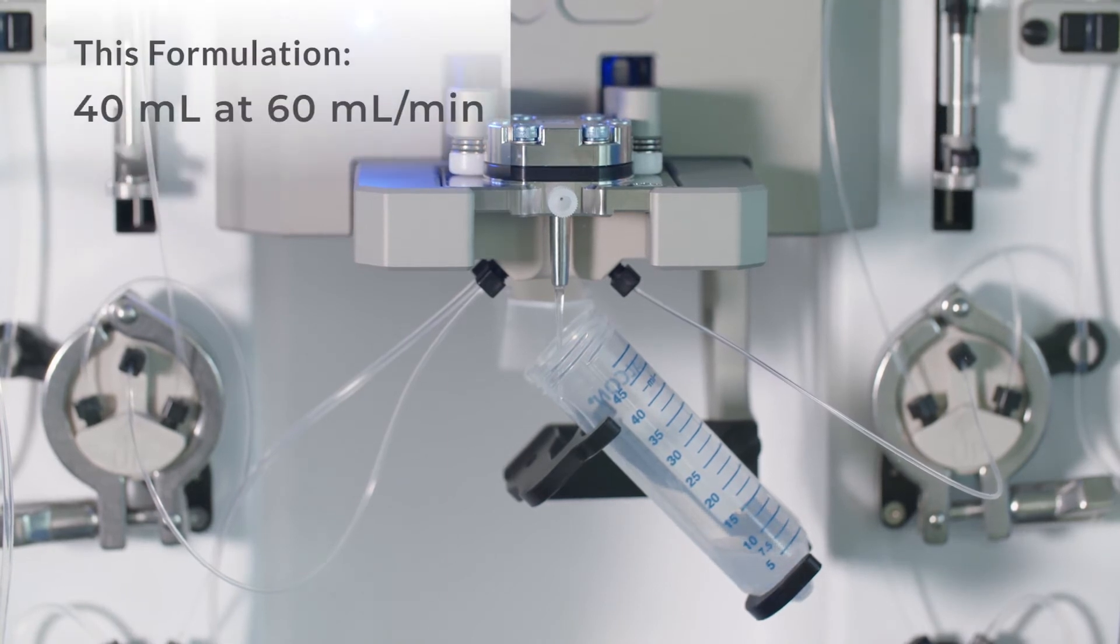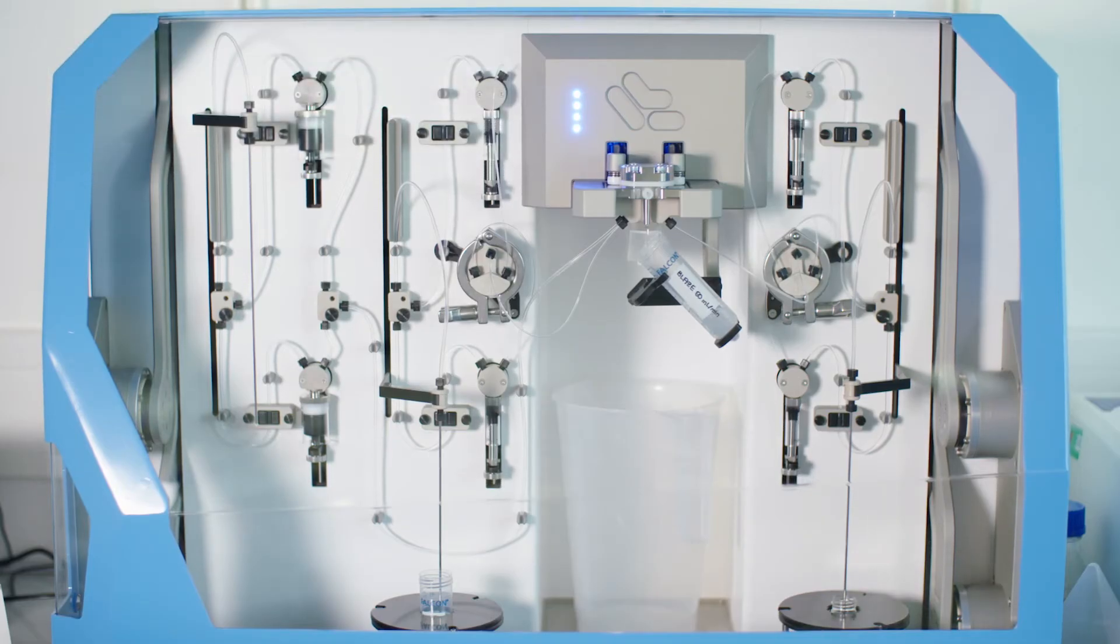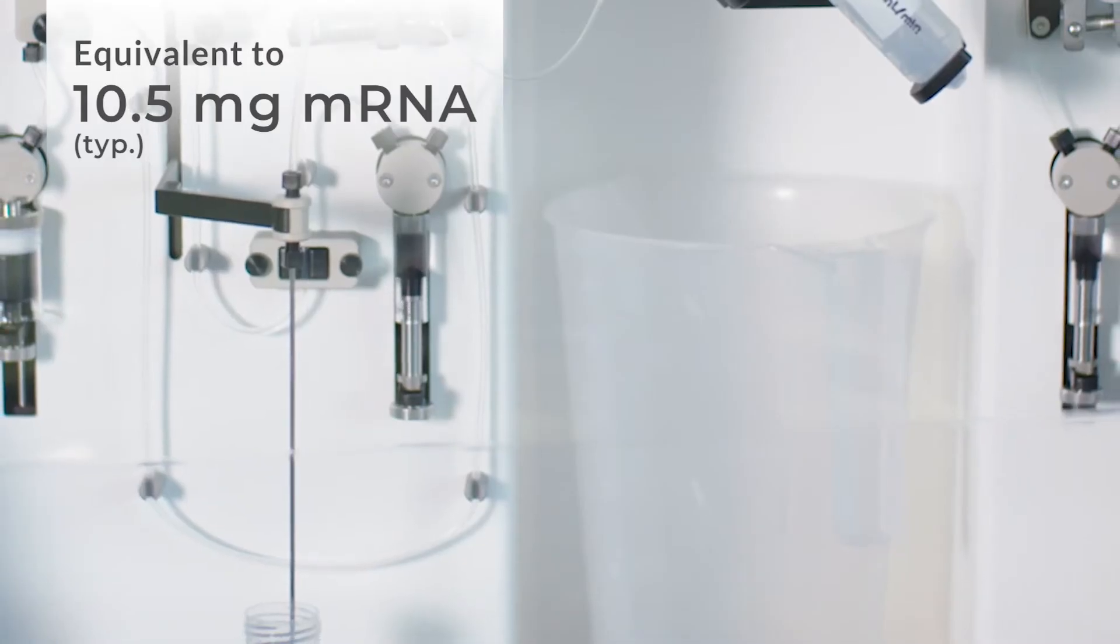Here we are making 40 mLs of undiluted formulation using NextGen 400 at 60 mLs per minute. The run takes about 40 seconds and formulates 10.5 mg of mRNA in lipid nanoparticles.